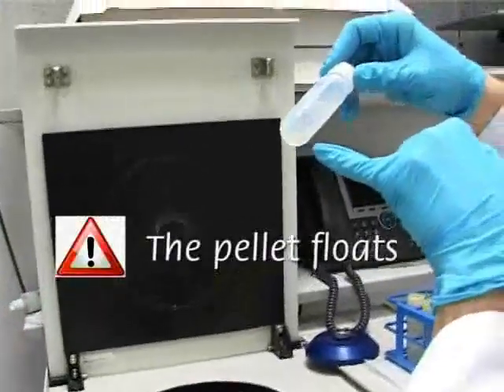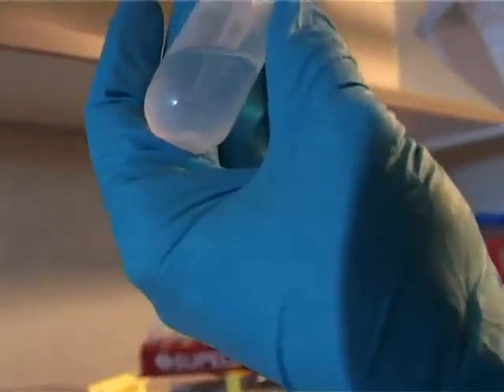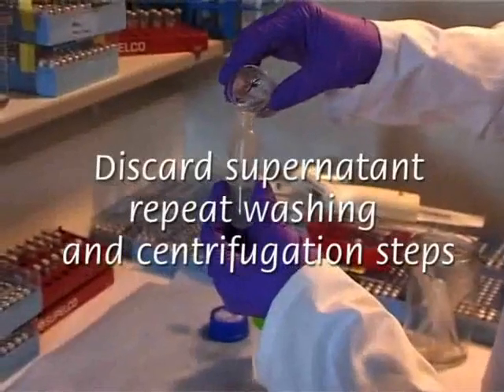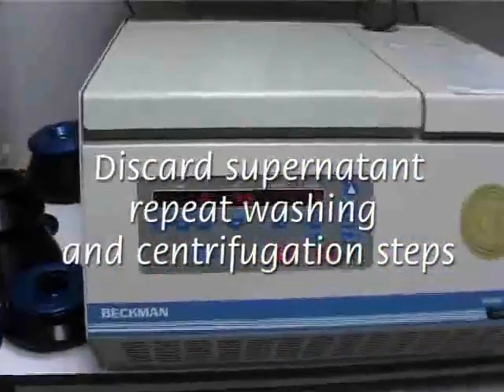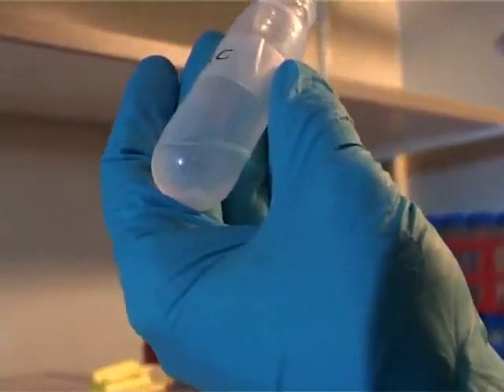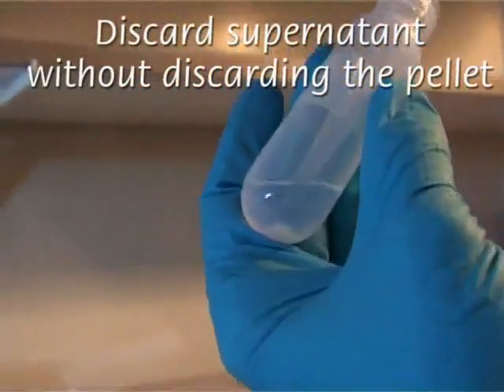The protein pellet is now floating, so attention should be paid to eliminate the supernatant. A second washing step is performed, adding washing buffer, shaking and centrifuging. The supernatant is eliminated and the sample is dried using a speed vac.